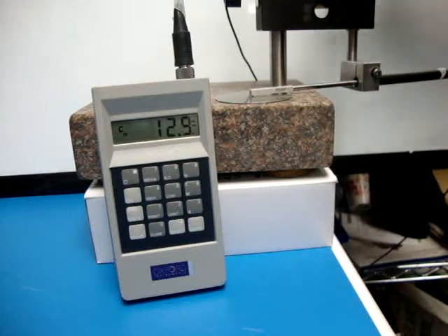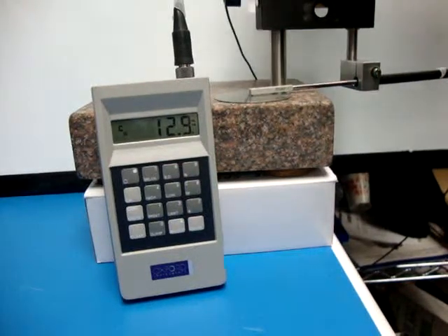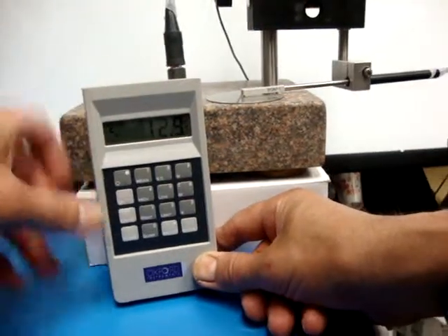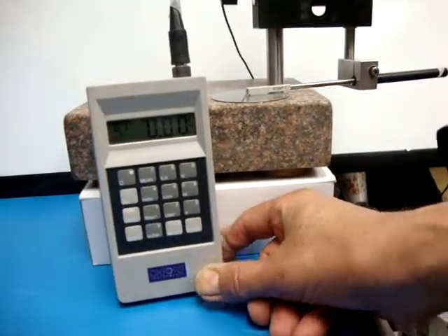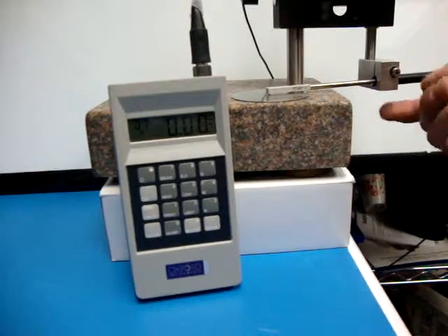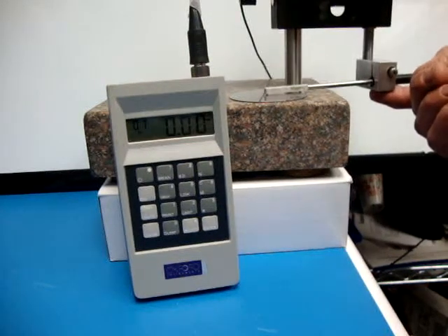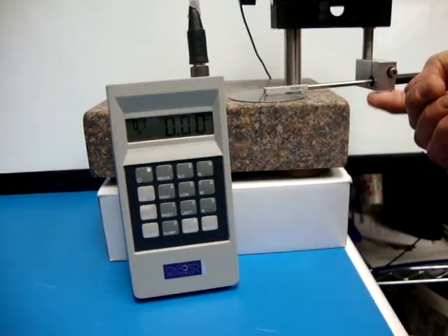Placed on the base, once placed on the base, I'm going to hit zero units. And that way it'll be zeroed out to the base, and each subsequent measurement comes out zero.